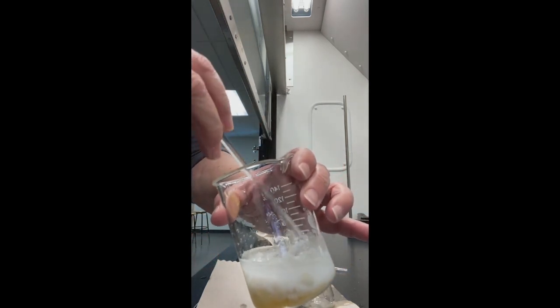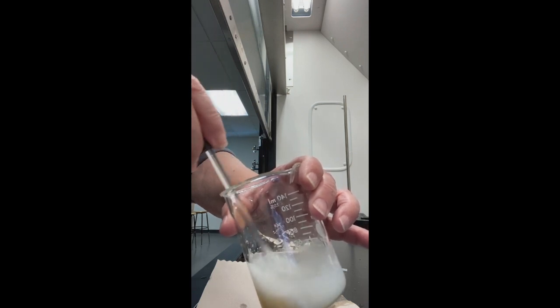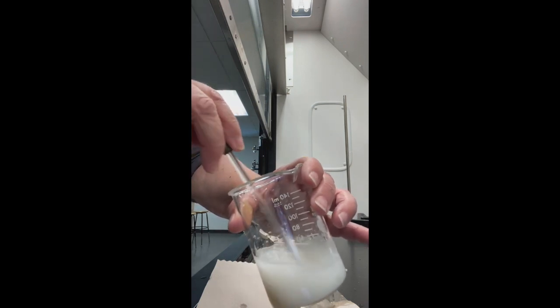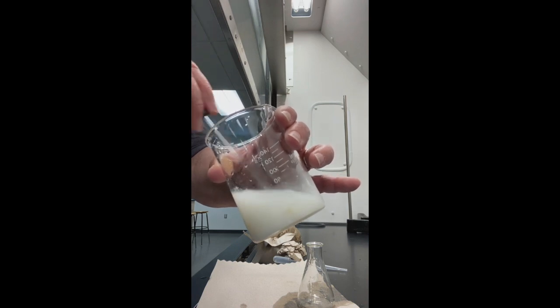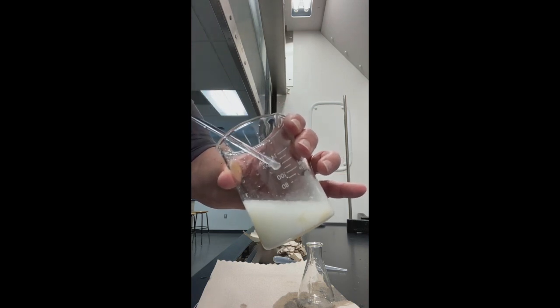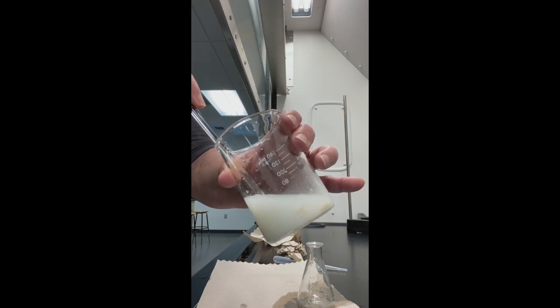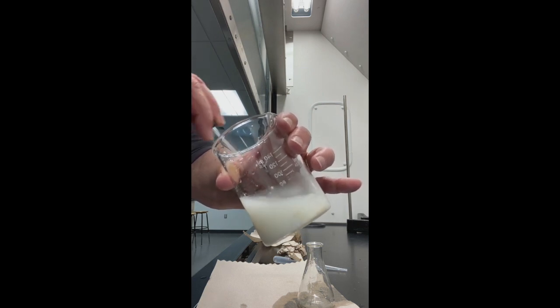You see the steam coming off of that? The reason why we use ice and not just water is because it's going to get hot and exothermic. And now you can see I have a cloudy solution. Those are my crystals. So we're successful in this. We are able to make the crystals.